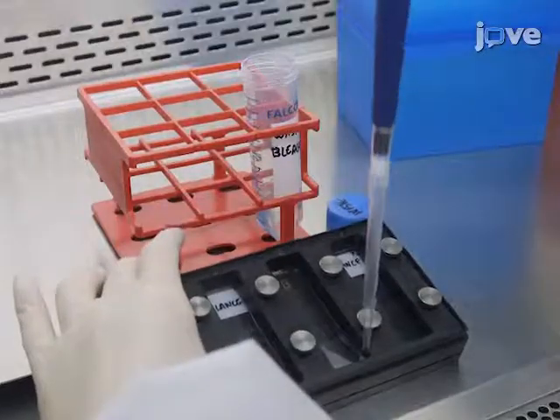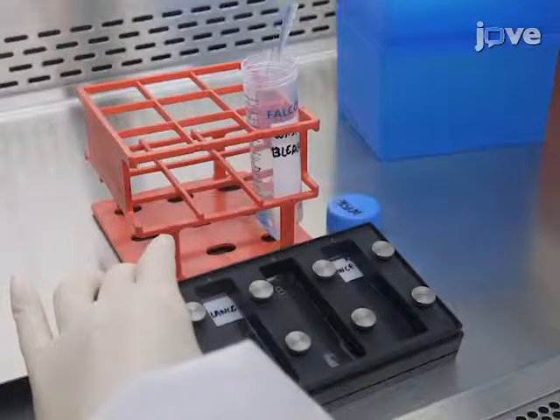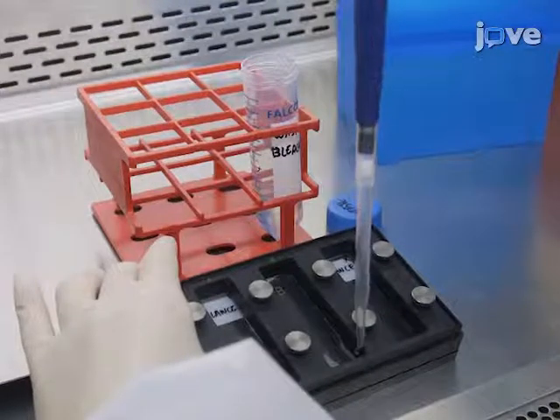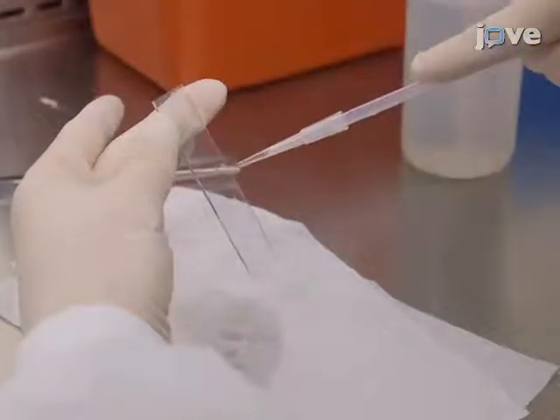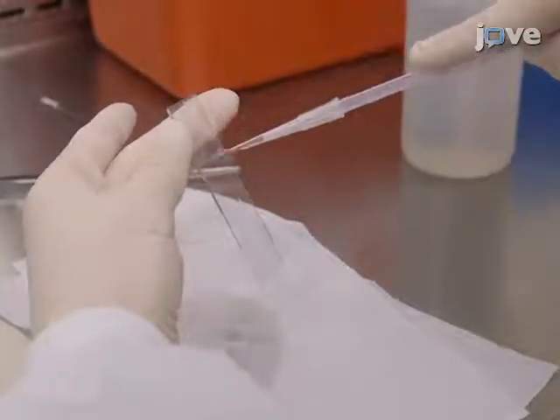Careful handling of the microarray is essential to avoid scratching the microarray surface. Solutions are added to and then removed from the corner of the microarray chamber. Drying the microarray is also important to provide a good scan image.